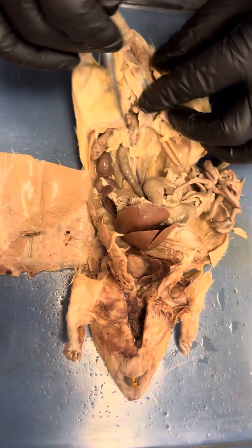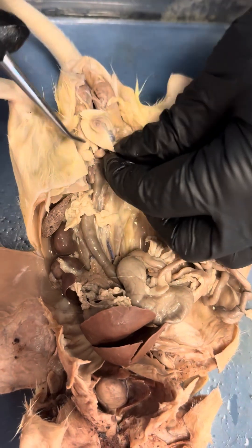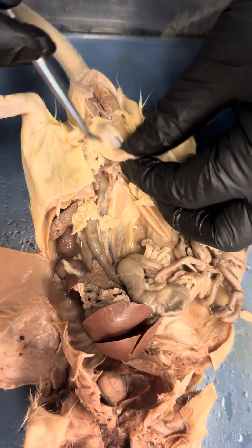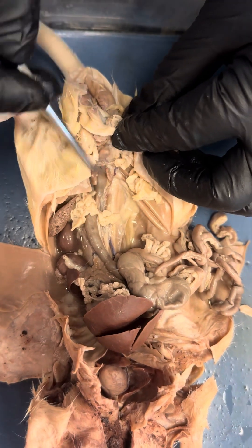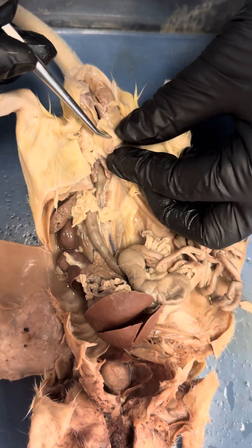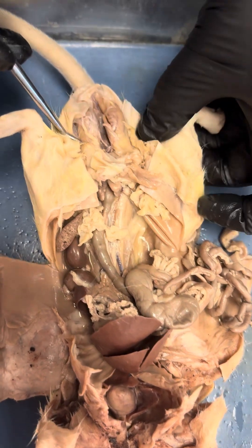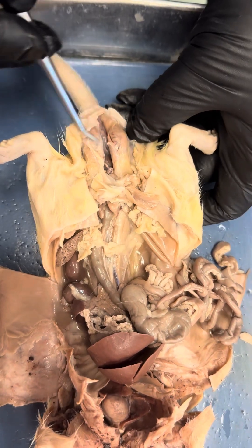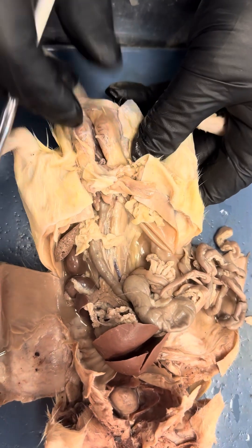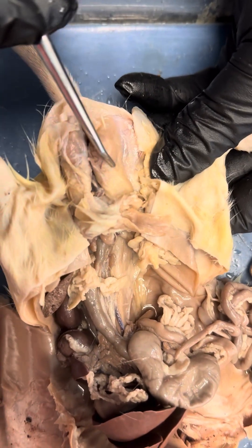I want to show you the reproductive organs right here. This is the penis right here. This is the urinary bladder. These are the testes, both sides — right and left testes. And I can show you the epididymis right here — see, this is the epididymis, both sides.